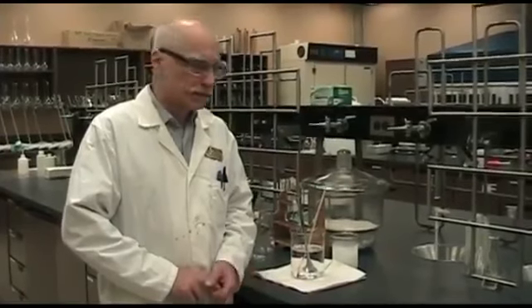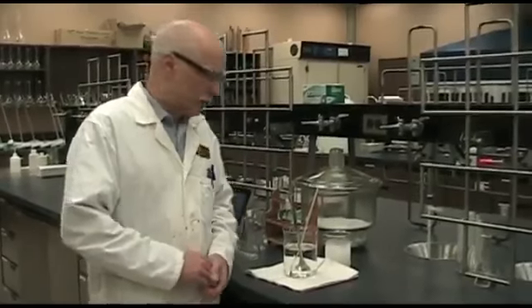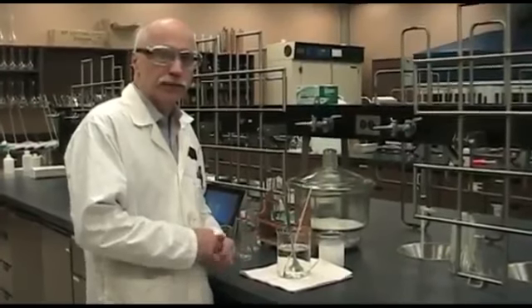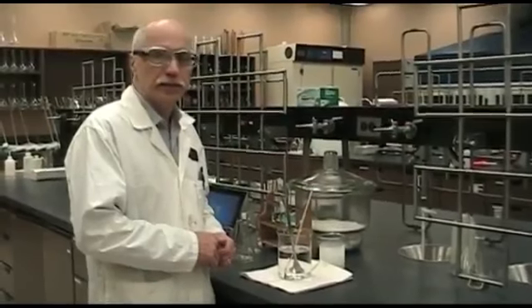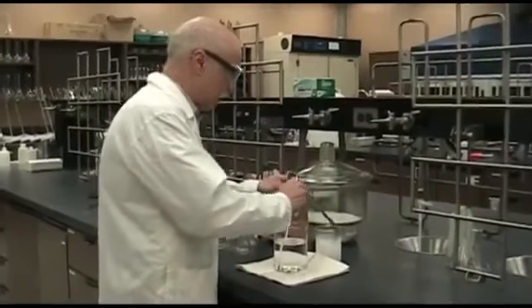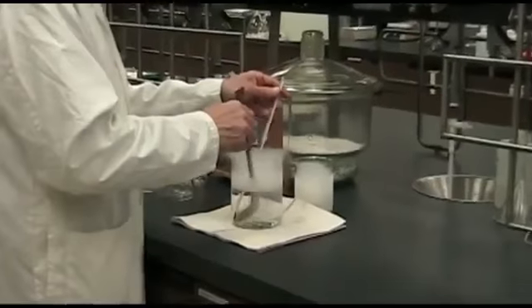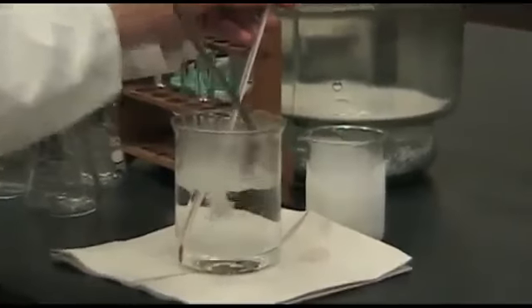And we will determine the van 't Hoff factor, i. So we'll begin with getting our ethanol solution down to -40 so that we can freeze the sucrose, the sodium chloride, and the calcium chloride. We get the ethanol down to -40 by adding dry ice, carbon dioxide, and this will take several minutes depending on how quickly you add the carbon dioxide.